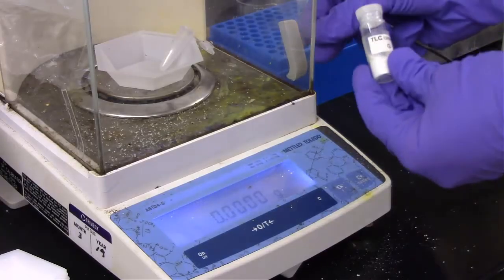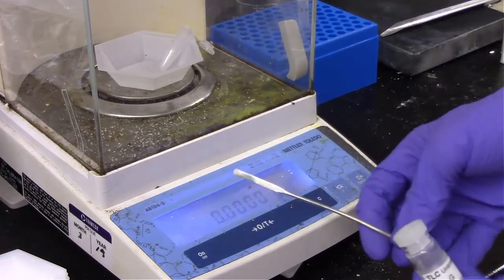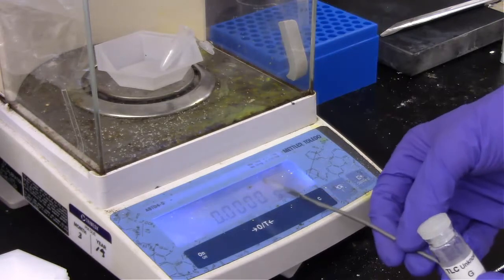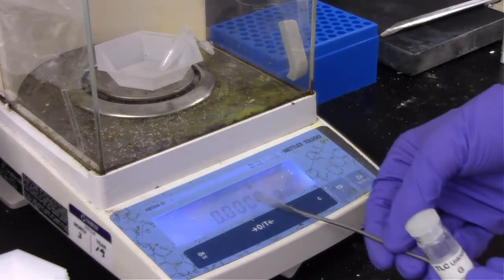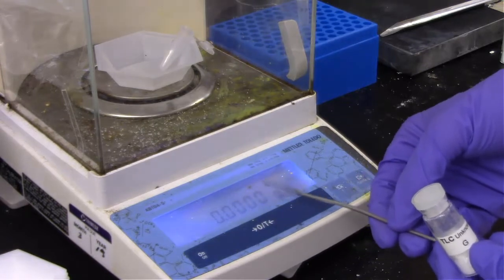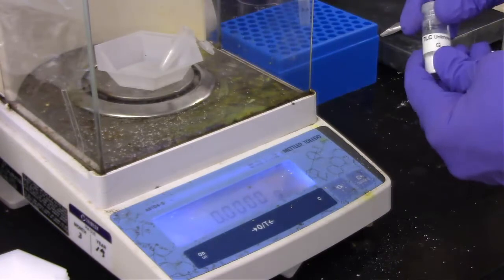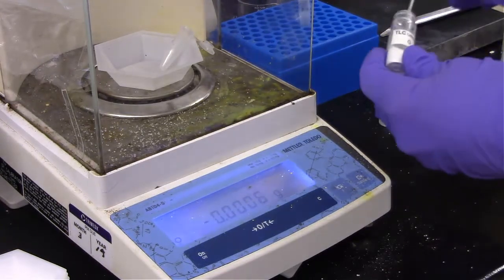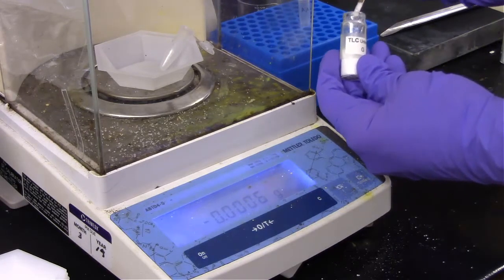All right, we're going to start with G, and we're going to get 1 milligram of G. Let's first start by looking at this. So this is actually in units of grams. We could adjust this or just realize that 1 milligram is that unit right there. So if this reads 0010, that would be exactly 1 milligram. As long as we're pretty close on these, that's all that matters.